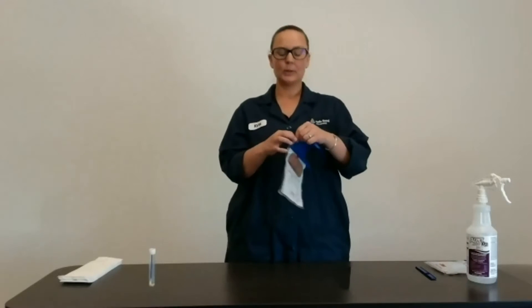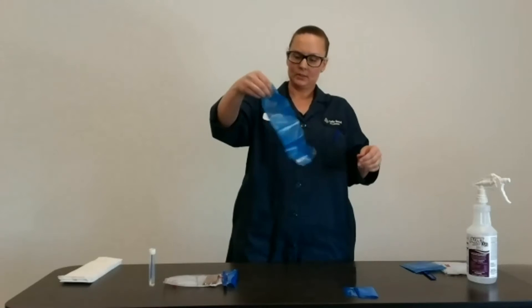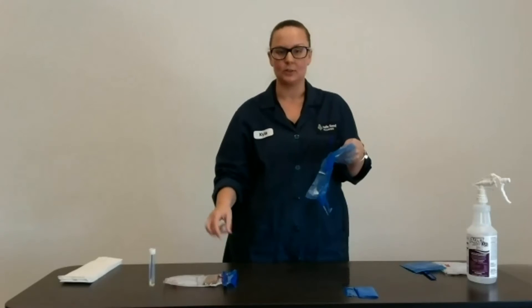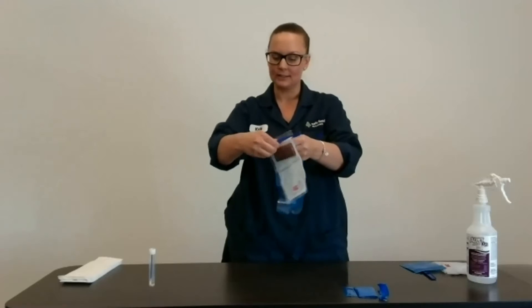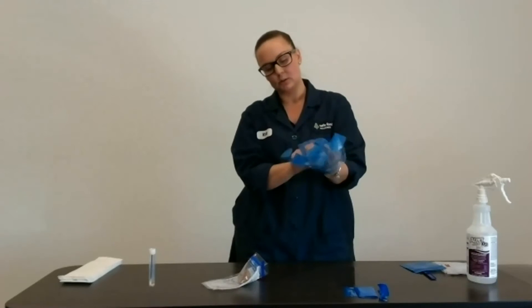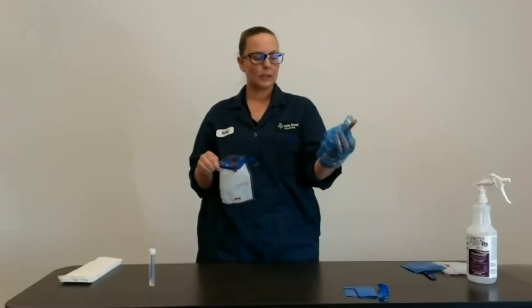This next one is a little bit more difficult and more time consuming. The gloves actually come with the sponge itself. You don't want to touch the sponge area because this is what's going to be contacting your swab. This is difficult if you're doing it by yourself — if you have two people swabbing it would be easier. You want to try and tear this off before putting your glove on, but it's quite hard. A lot of the times people don't really use these, but they are definitely an option.